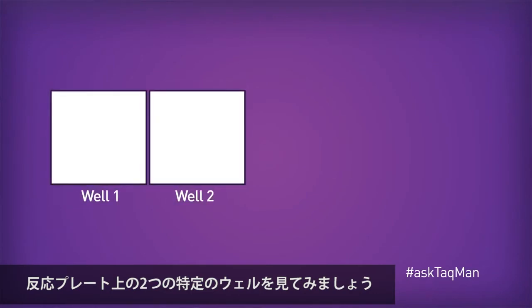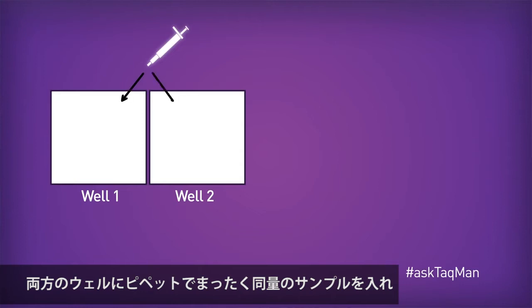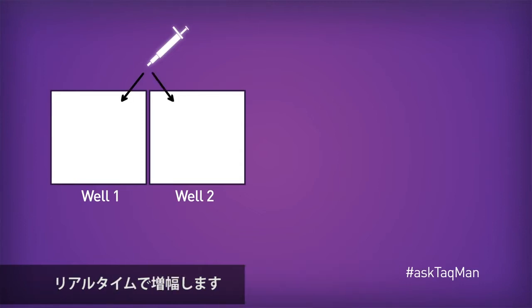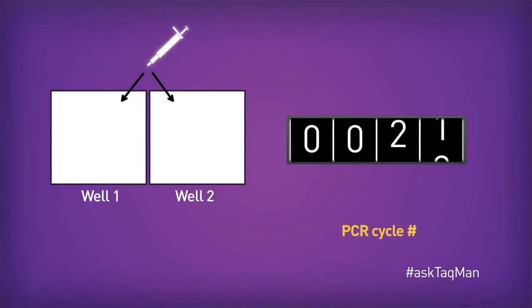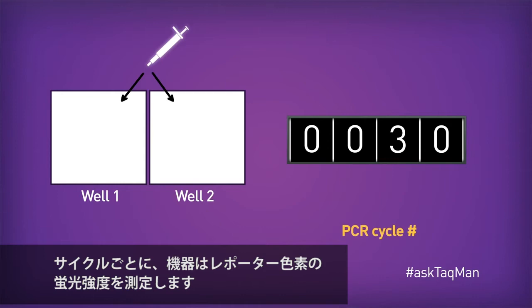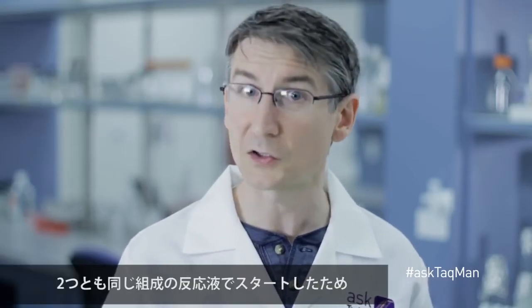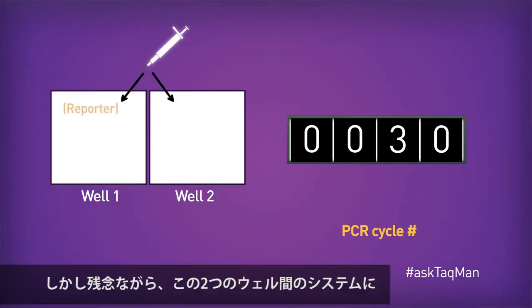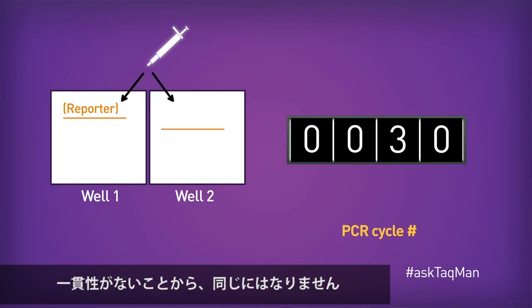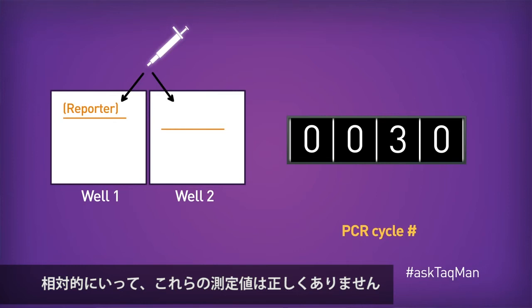Here's how it works. Say that we're looking at two specific wells on my reaction plate. I pipet exactly the same amount of the same sample into each, and then amplify in real-time. A short time later, we reach cycle 30. As at every cycle, the instrument will take a reading of my reporter dye. I expect those two readings to be identical, since I started with the same reaction components. Unfortunately, they're not, due to a system inconsistency between these two wells. Relatively speaking, these measurements are incorrect.